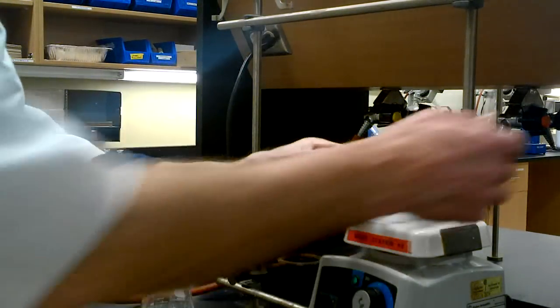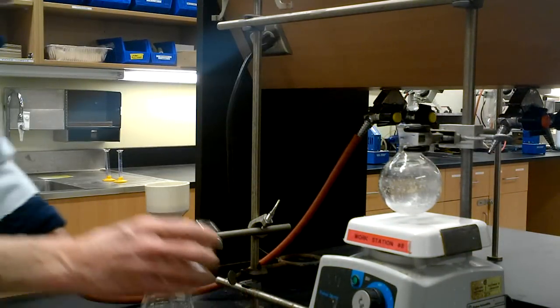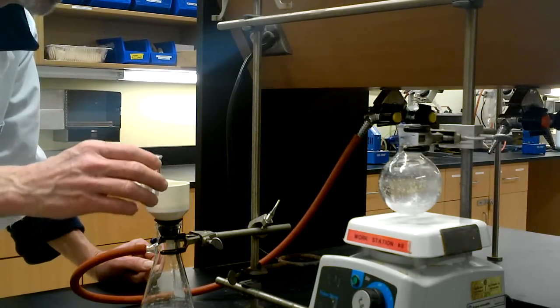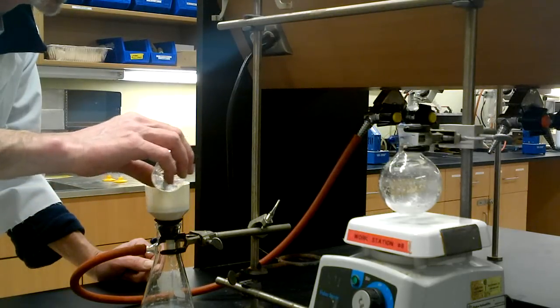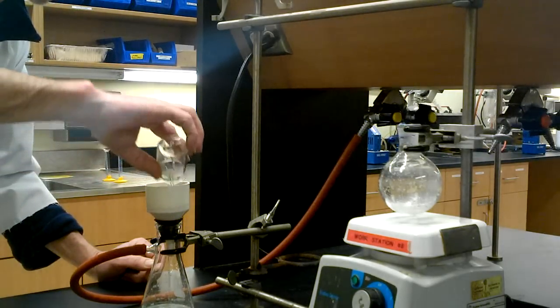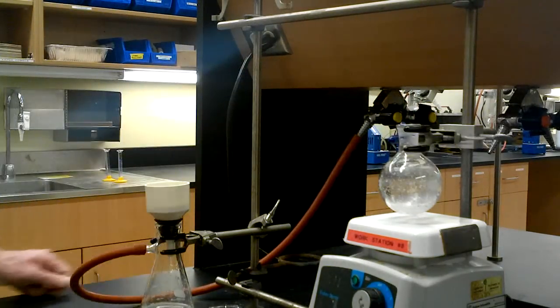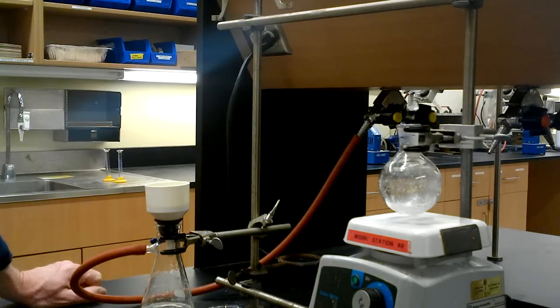I have to wait a little bit. I didn't get it all, but I'm not too concerned. Suck this really dry, and I'm going to wash this with lots of water. It's just come out of acid, so we really do want to get the acid washed off here. We'll suck that dry for three to five minutes, and then move on to the recrystallization.